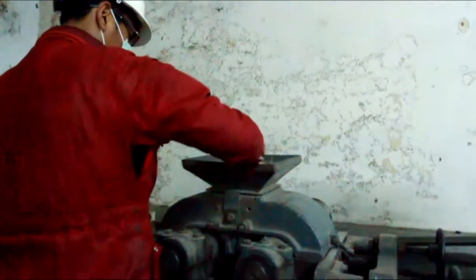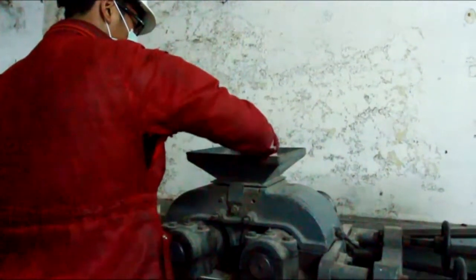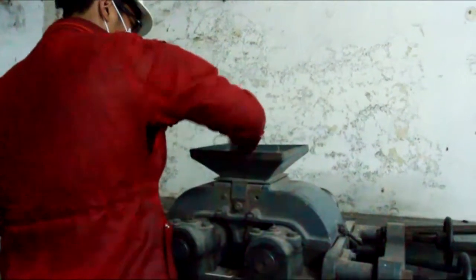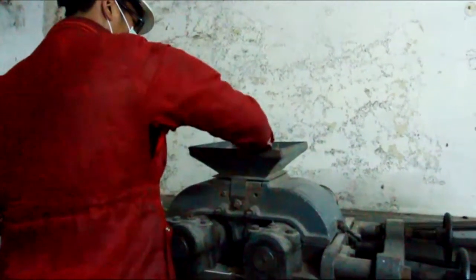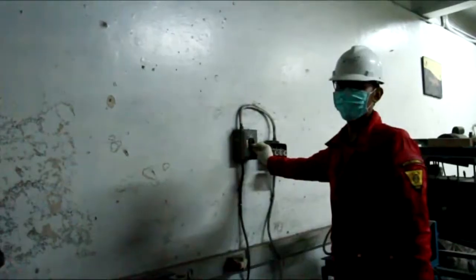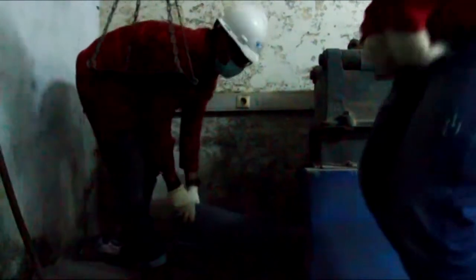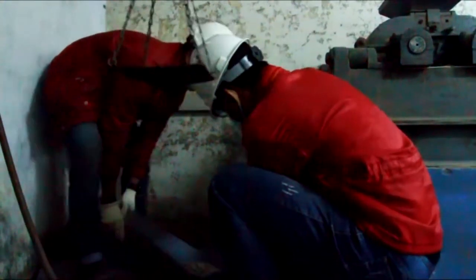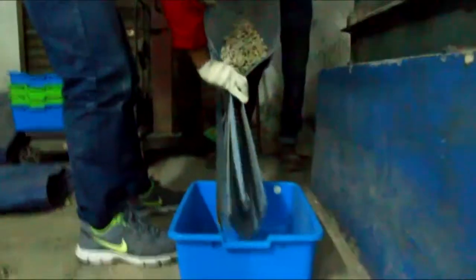C: the second stage is the secondary crushing. In this stage, the results of the previous stage are crushed again using a roll crusher. Participants manually set the width of the gap of the roll crusher and will operate the roll crusher by themselves.